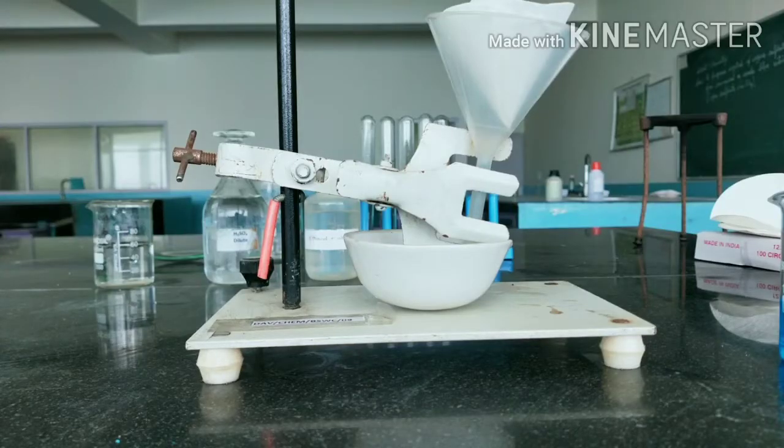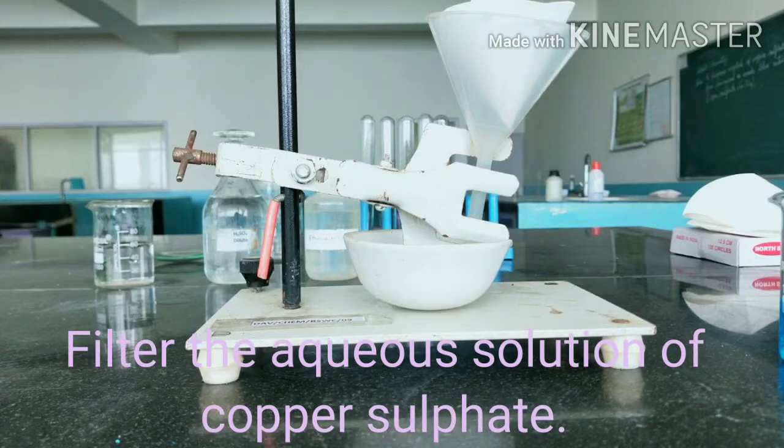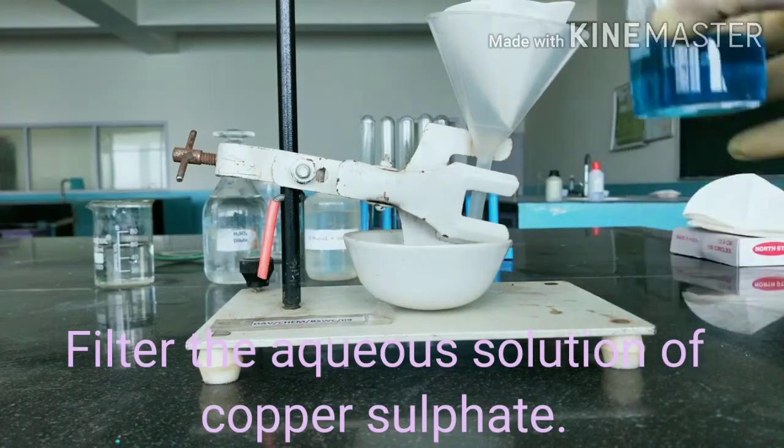Now, the funnel is situated on the clamp stand in such a way that its end will touch the sides of the china dish to avoid the splashing. And we will filter this copper sulphate in it.